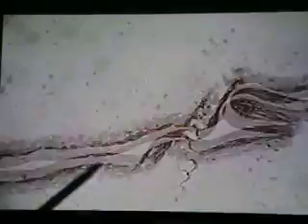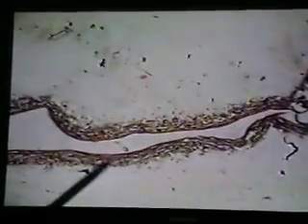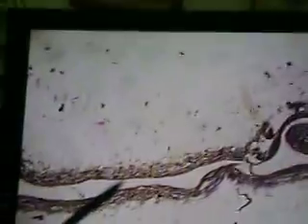Okay, cardiac, right, veins. So let's look at a vein. I don't know how this one looks. Well, this vein is not looking very good at all. But this is an example here of a vein. Not a very good one at all. The staining is very poor, and we compare this with the artery. That's the aorta right here, and that's the inferior vena cava.